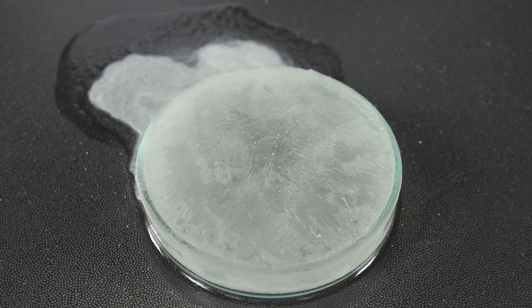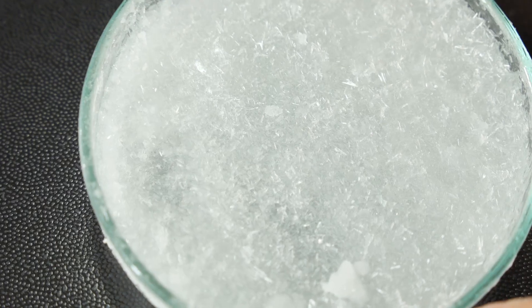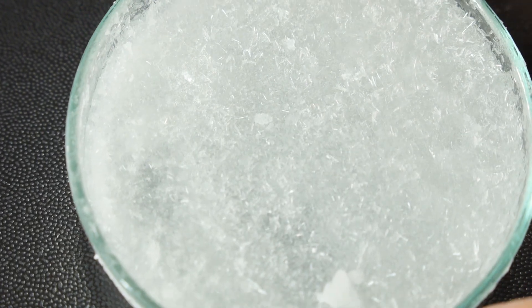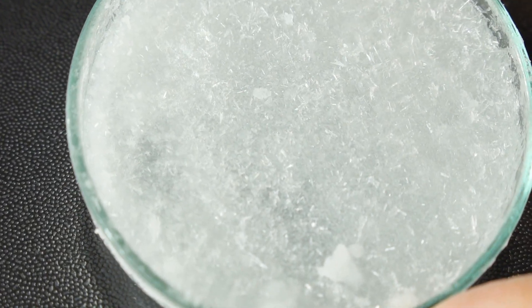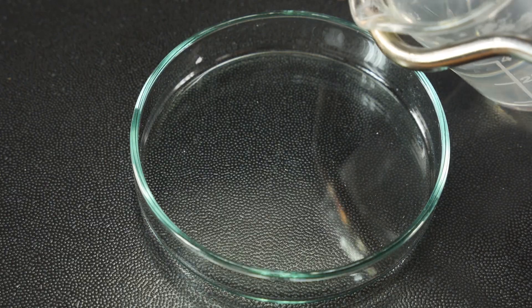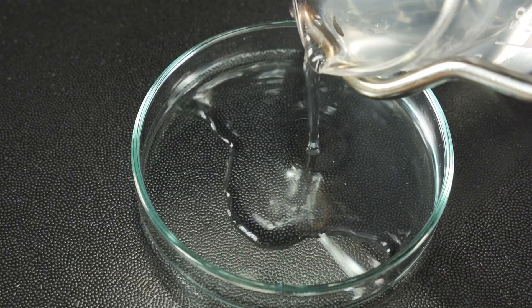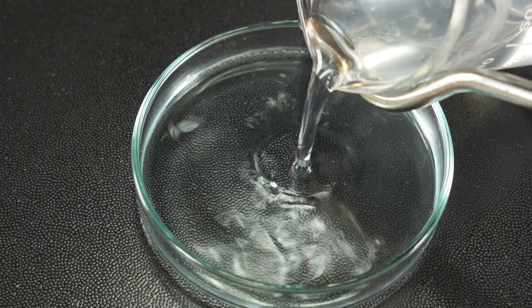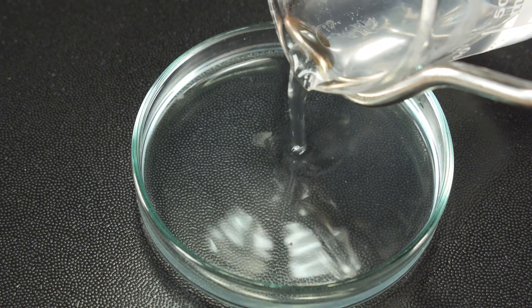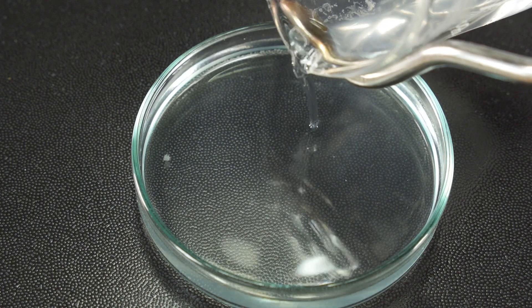Because we have put so much potassium nitrate, we can't see the forest for the trees. We will repeat the experiment, but with a lower concentration of potassium nitrate, and thus be able to see how the crystals grow in the solution. Let's do this again.